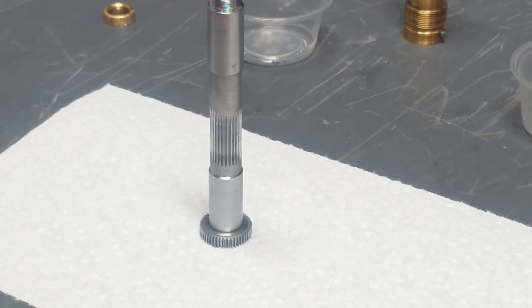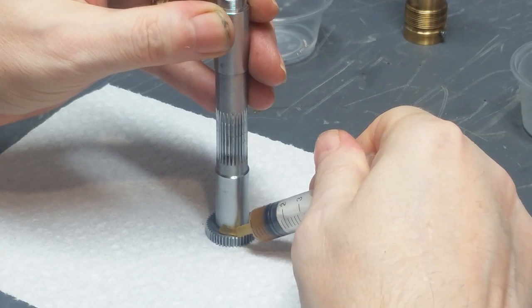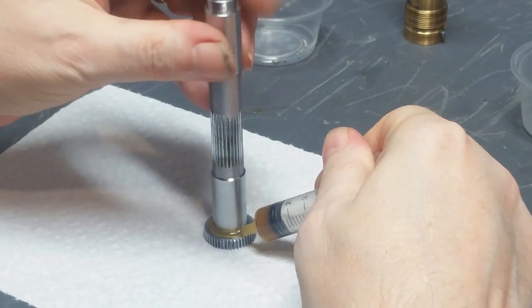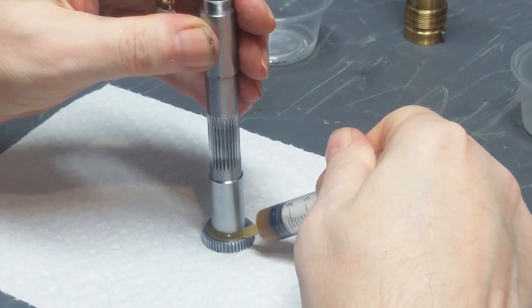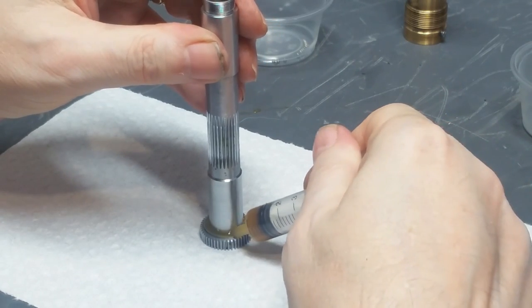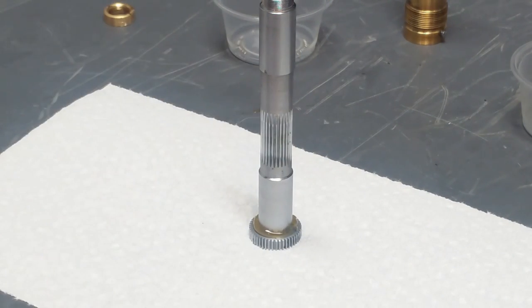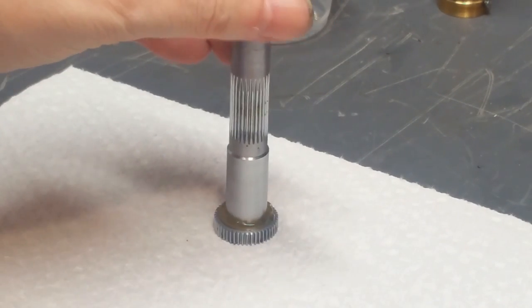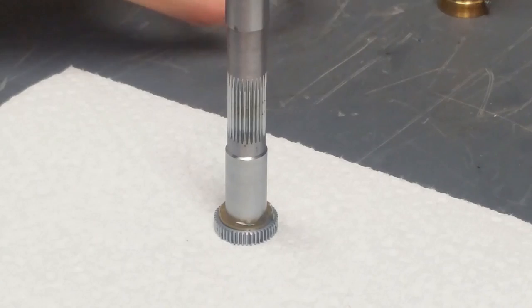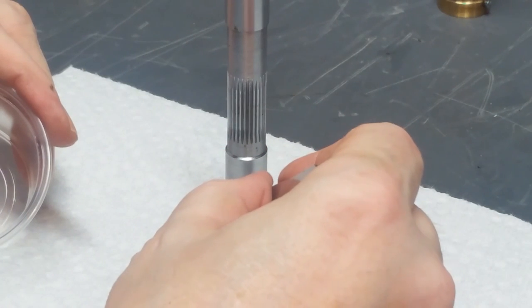Okay. First thing I do is I take some Plastilube brake grease and I squirt a bead of that all the way around the face of this gear. Okay, so that takes care of that. Now what I'm going to do is lay the 30 bearing balls. Take a pair of tweezers and just embed them in the grease all the way around there. It's tedious and frustrating, but it has to be done.